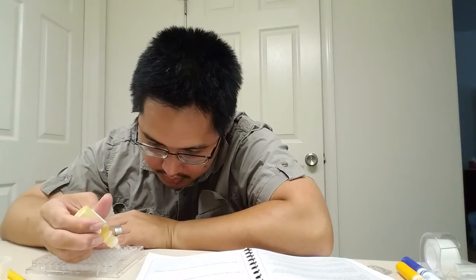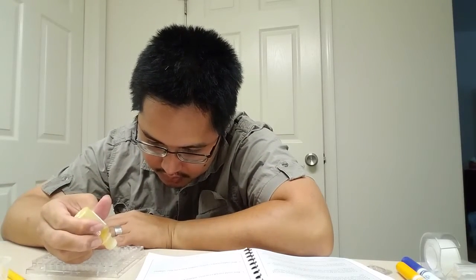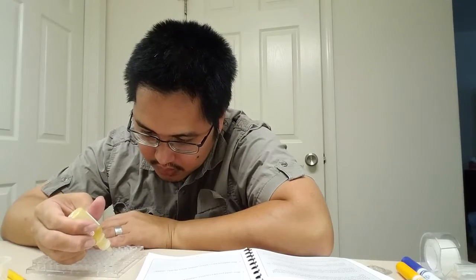Now I apologize for this in your example video, but I've run out of lead nitrate, so I'm going to use iron nitrate and see if that does anything different with the experiment. But you would use lead nitrate. I'm just showing you how it's done. So we've got C1, 3 drops each.